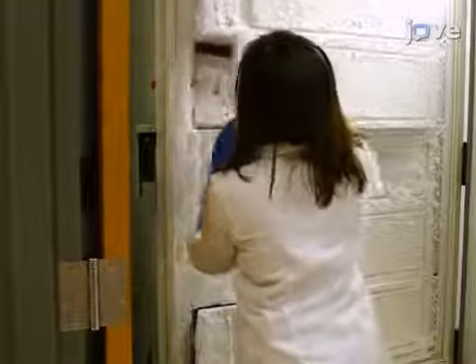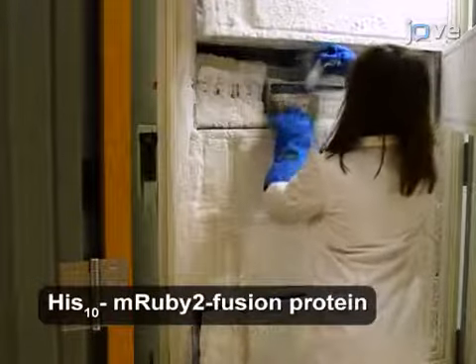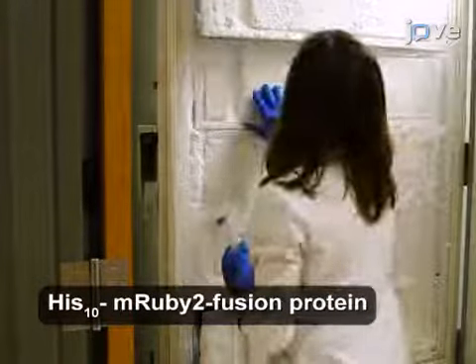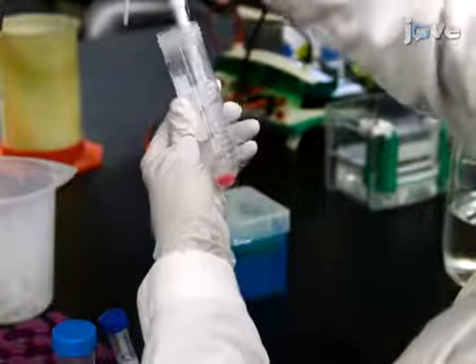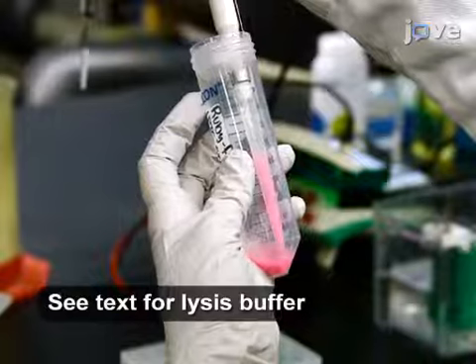After generating expression plasmids and testing their expression levels as detailed in the text, begin purification of each strain that successfully expressed ruby-tagged protein. To lyse the cells, first resuspend each thawed cell pellet in 1.5 milliliters of lysis buffer that has been supplemented with protease inhibitors.